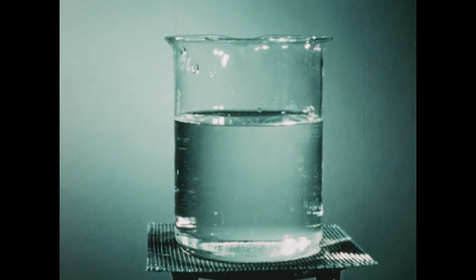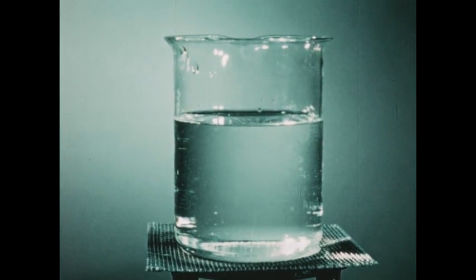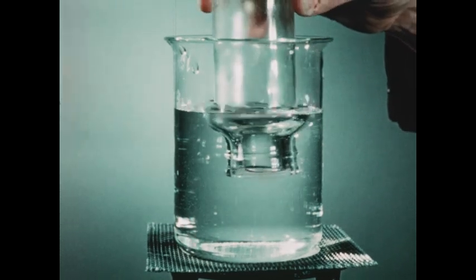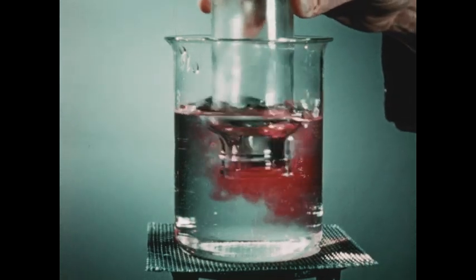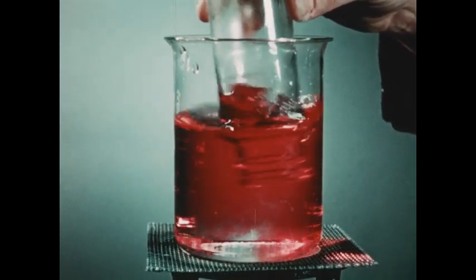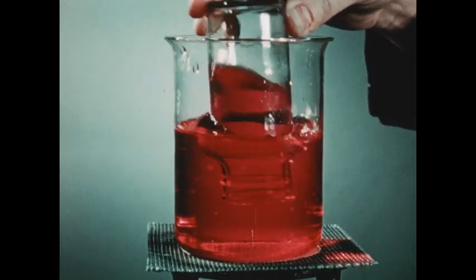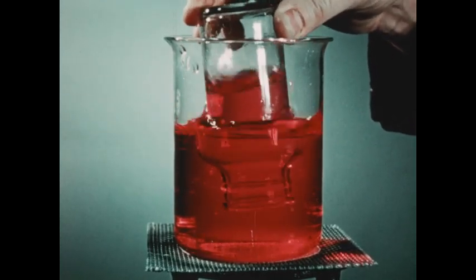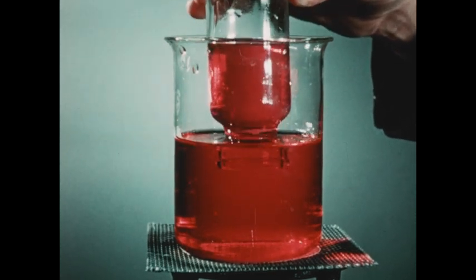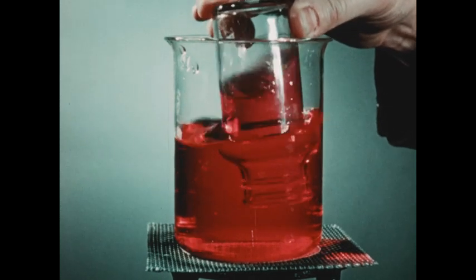Previously, the statement has been made that ammonia is quite soluble in water. To illustrate this point, I'll place a bottle of the ammonia that we've just collected in this beaker. The water in the beaker contains some phenolphthalein that we've added. You see that the water is rapidly rising in the bottle, indicating the speed with which ammonia dissolved. You see also that this water has turned red, once again indicating ammonia's properties as a base.